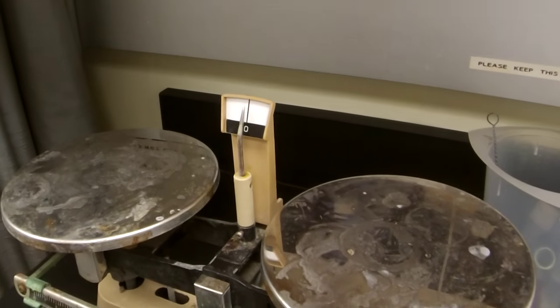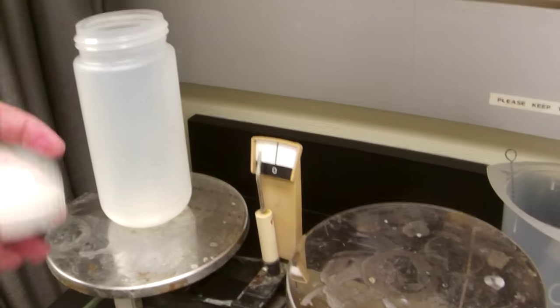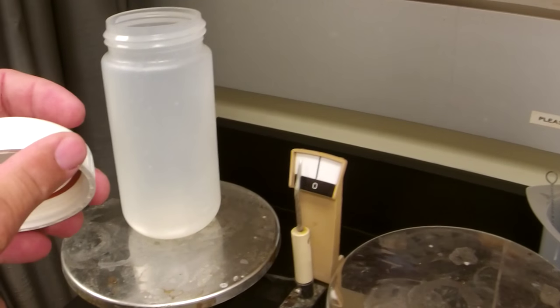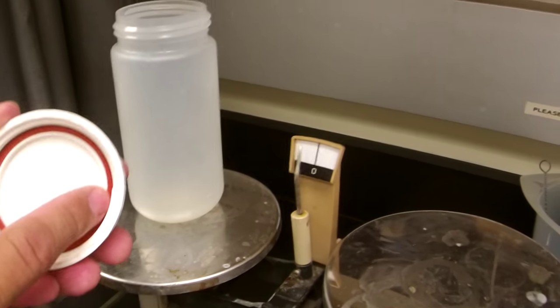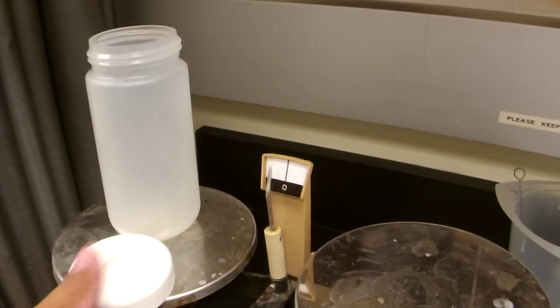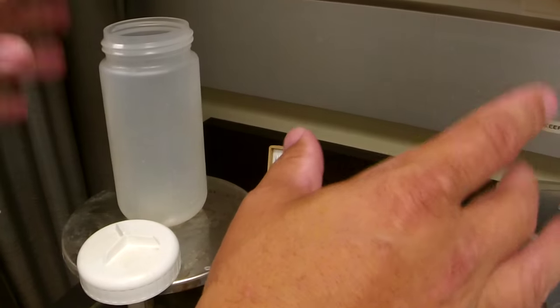If you're using the larger tubes, put the bottle on the pan and the top as well. There can be some variability in these tops depending on the lot. Always make sure you check for the O-ring. No matter what, whatever is balanced across must go across — that pairing must be maintained.